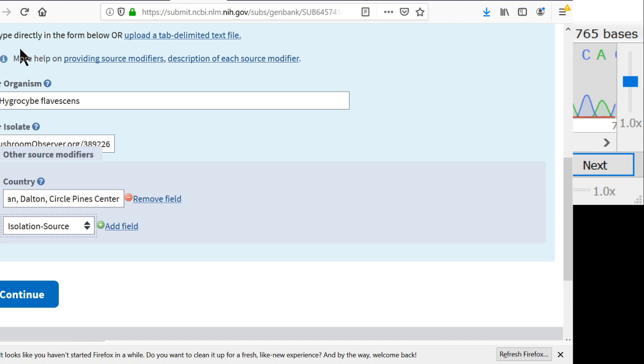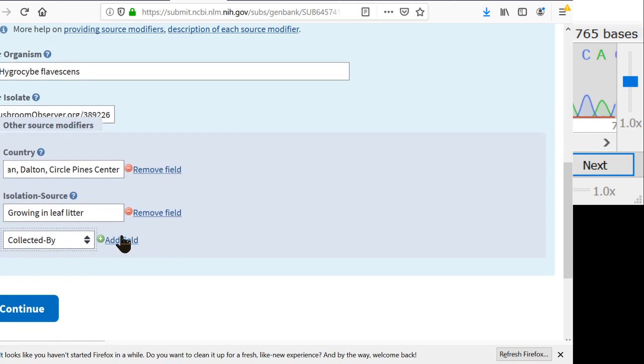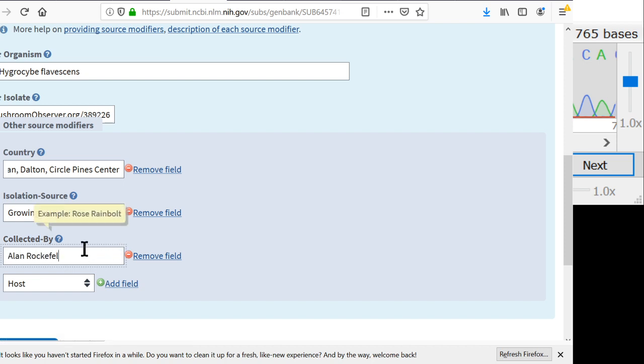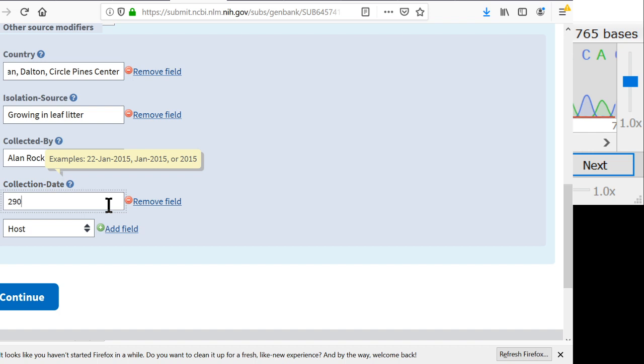Isolation source. Host is usually not used, but isolation source can be used as saying what kind of stuff you found it in. So this was just in leaf litter. So this is kind of a free-form field. You can just type stuff in here. Growing in leaf litter. And collected by is a good field. And I don't have the latitude and longitude right now. I could look up the latitude and longitude of Circle Pines Center, but it's not super important. And the collection date, I don't remember which day it got collected, but that's okay. Actually, I think it was around, yeah, it was like the 29th of September.